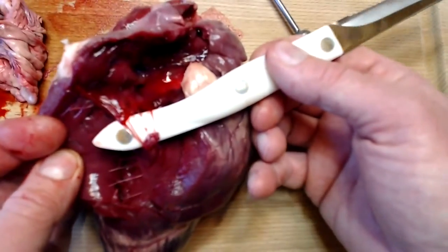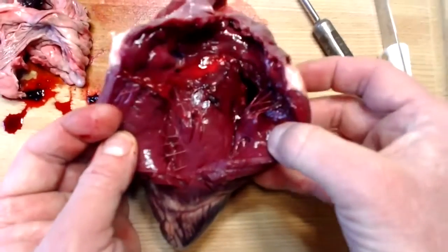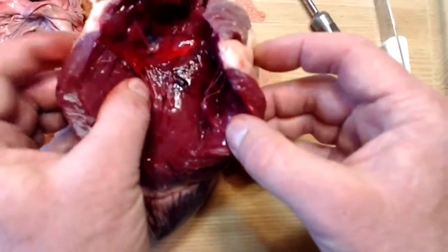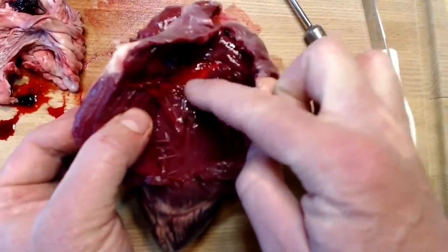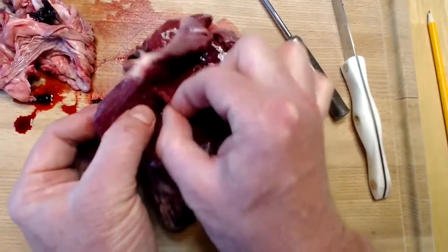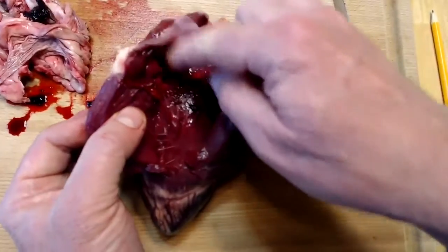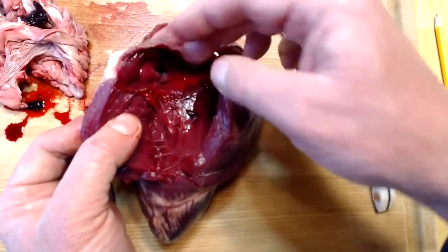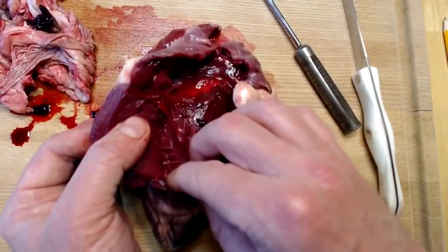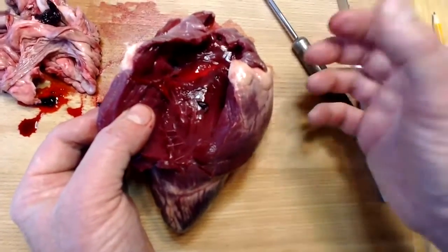They're very strong cords. And what they do is when the right ventricle contracts, this papillary muscle also contracts, and it prevents prolapsing of the AV valve back into the atrium. So that's what they do. They pull on the valve when the ventricle contracts, so the blood doesn't regurgitate back into the atrium. Because remember, the blood is moving from the right atrium into the right ventricle. And then from the right ventricle, it's being taken out the pulmonary arteries to the lungs.